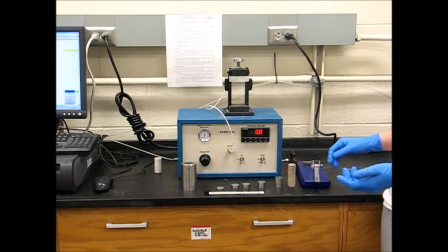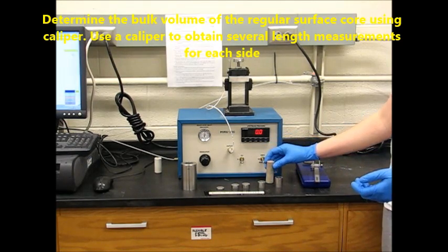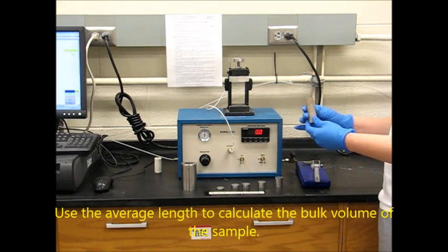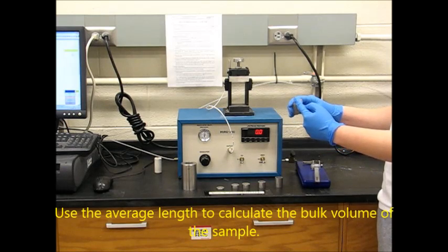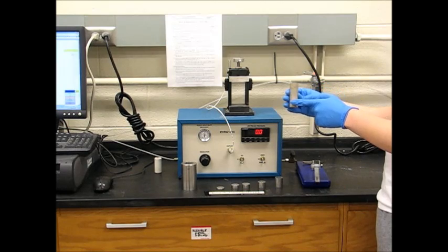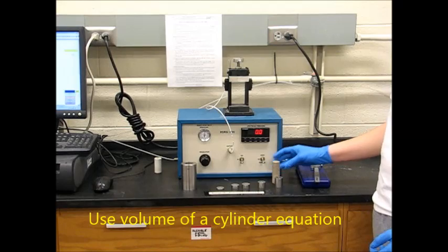The first thing that we're going to do in our procedure is measure the volume of this core sample. Because it has an irregular shape, we're going to take the average of 3 different measurements. So we're going to measure 3 different times on the top and measure 3 different times on this, and then average those to find the volume of the sample.